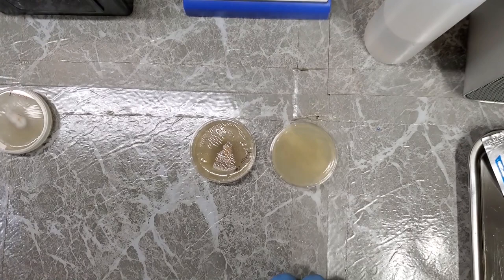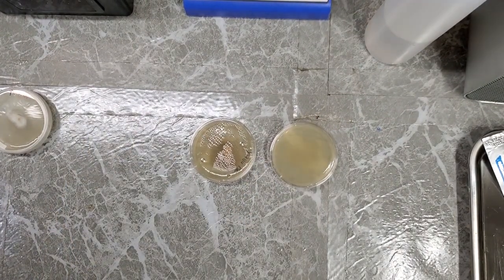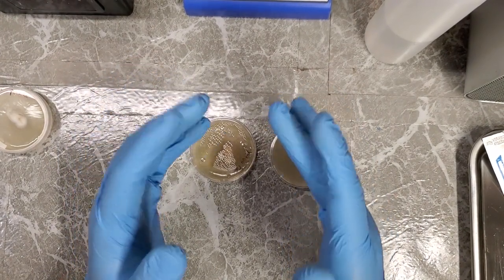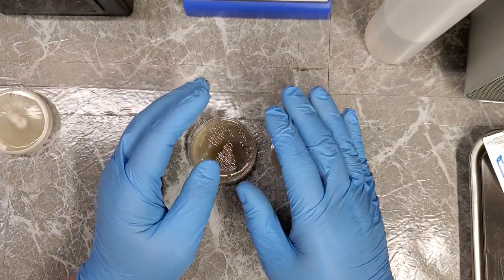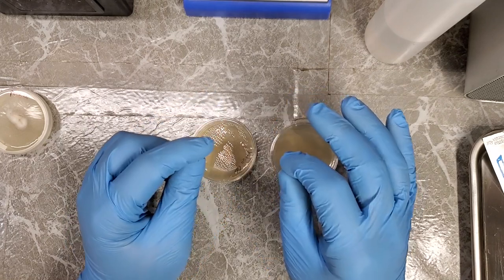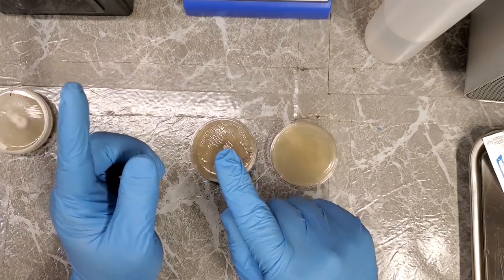So now I have the camera set up. That's good. This first one that I'm going to do, I'm only going to really worry about showing the proper way to do it. So I'm not too concerned about contaminations, because I'm going to use this one as an example of how to properly isolate a potentially successful culture sample from a contaminated petri dish.